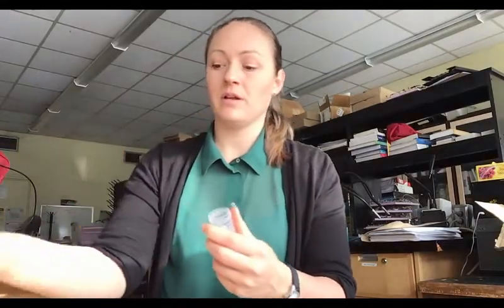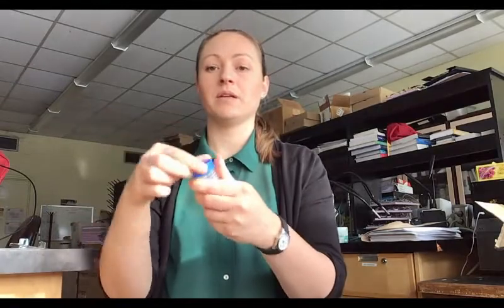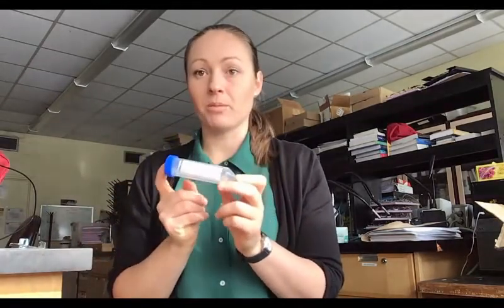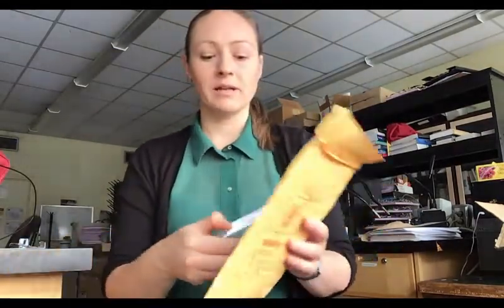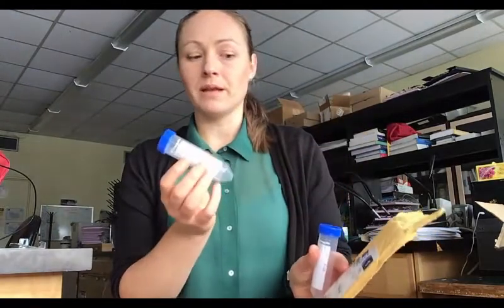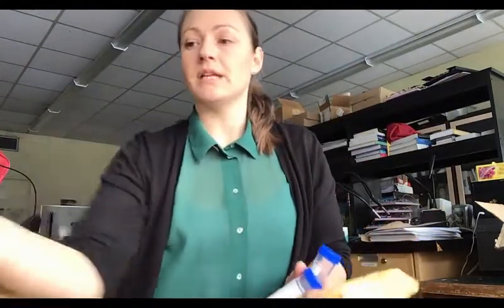When you're done collecting for the season, you can take your collection tubes and make sure they're all labeled properly. Your data sheet should also be labeled with the corresponding tubes.